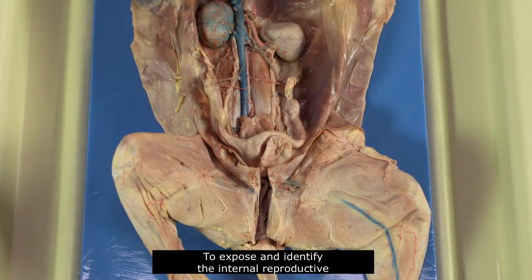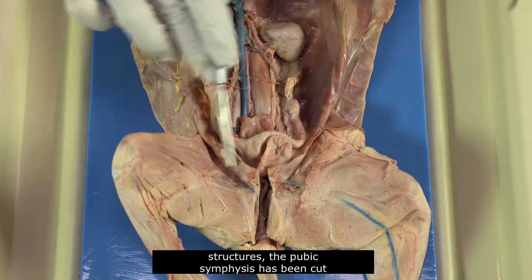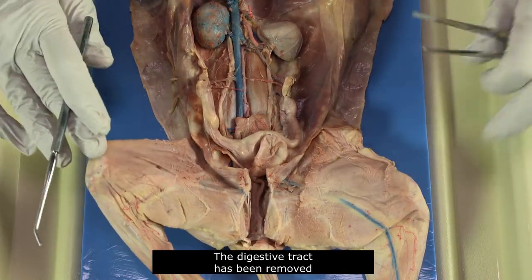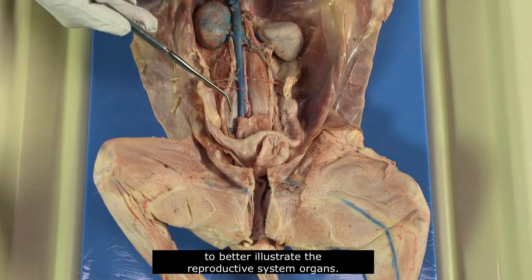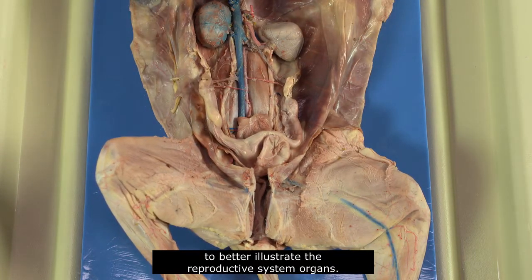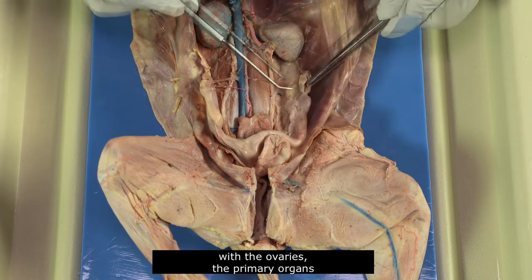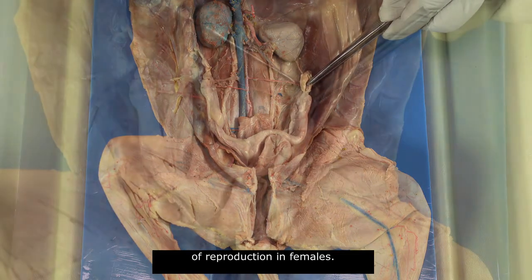To expose and identify the internal reproductive structures, the pubic symphysis has been cut to open the pelvic cavity. The digestive tract has been removed to better illustrate the reproductive system organs. We'll begin our review of female reproductive structures with the ovaries, the primary organs of reproduction in females.